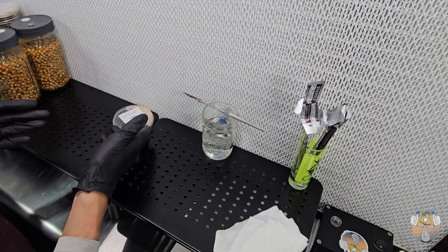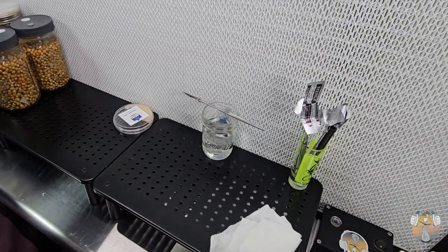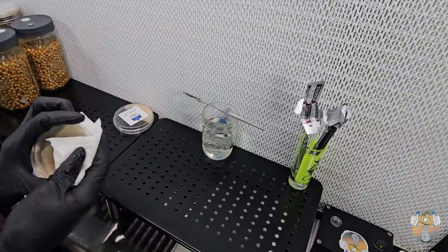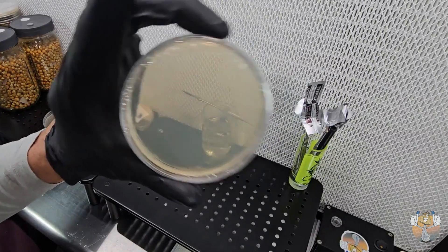Since we're already working with this genetic right now, I'm going ahead and making my transfers. I'm going to do three plates for each — because if two fail, I have one; if one fails, I have two. Nice clear plate — look at that.